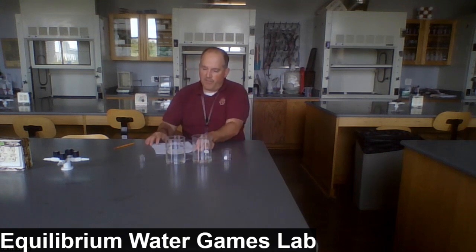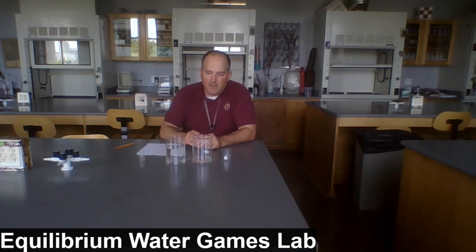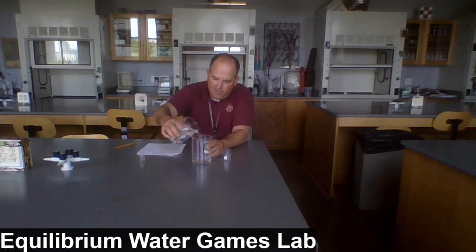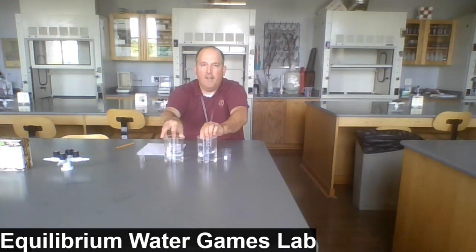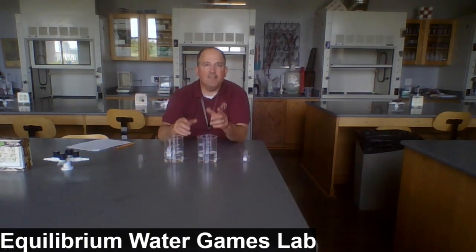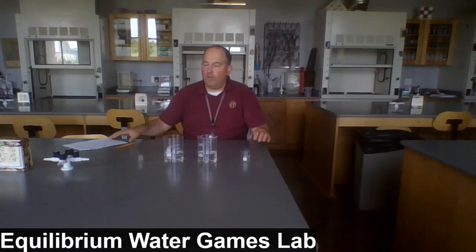Now for part 2 of the lab, it says repeat your procedure, except instead of starting with 500 milliliters in beaker A and 0 milliliters in beaker B, we want you to start with 250 milliliters in each. So now our beakers, or the large beakers, have the same amount of water. Let's see what happens. Are we going to reach the same equilibrium? Are we going to reach it quicker? Are we going to reach it less quickly? Don't know. Let's find out.